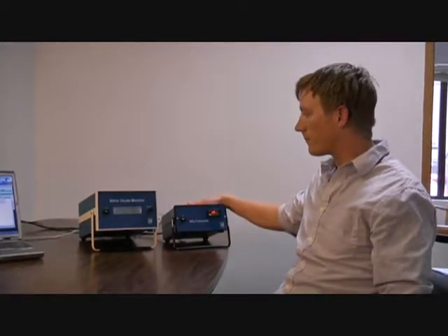Okay, in this section I'm going to talk a little bit more about the operation of the NOx system, and in particular I'm going to get into how to set up a typical setup for your conversion, how often you're reading NOx.